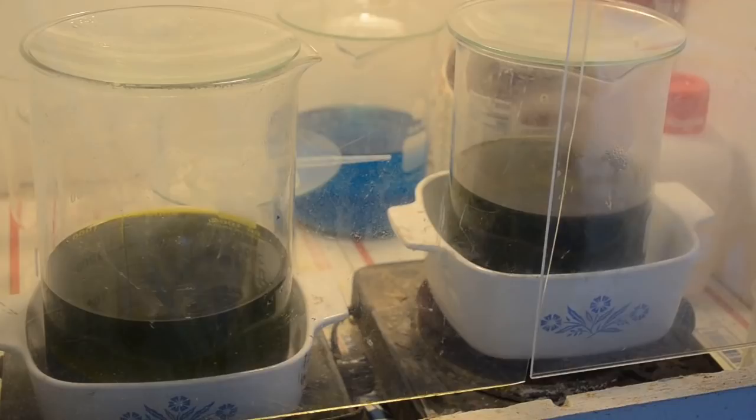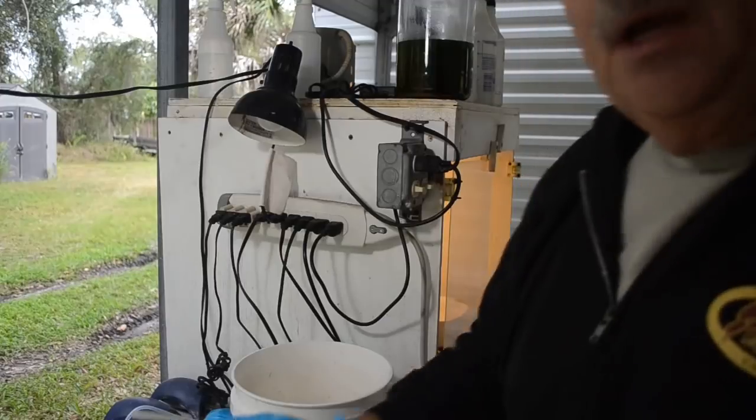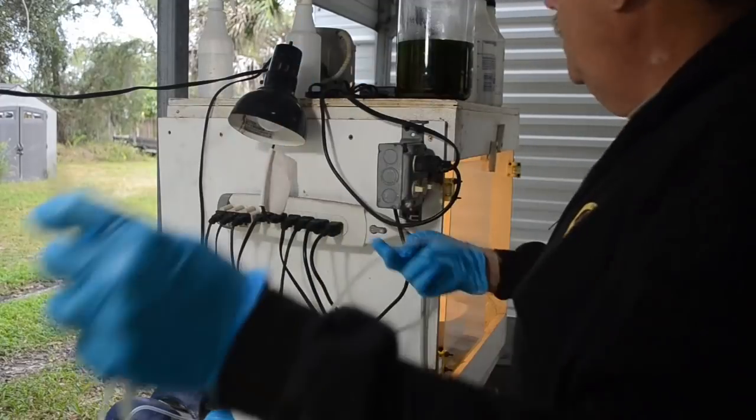Now I can see this is going to be a very long video, so hang in there. I'll probably break it up into 2 or 3 parts, maybe 4 parts to get through all this. It's just taken forever, but hey, at least you're not having to spend as much time on it as I am. You're just seeing it in segments. Okay. So let me get set up to siphon the liquid off of this, and we'll get that gold cleaned up. And meanwhile, this should be warming up. Alright, siphoning.